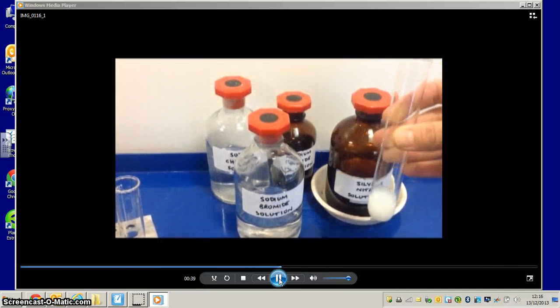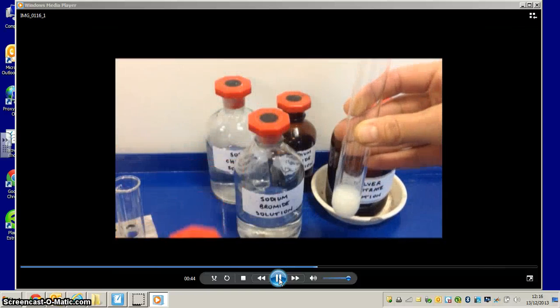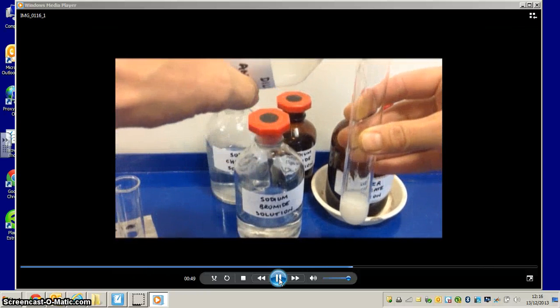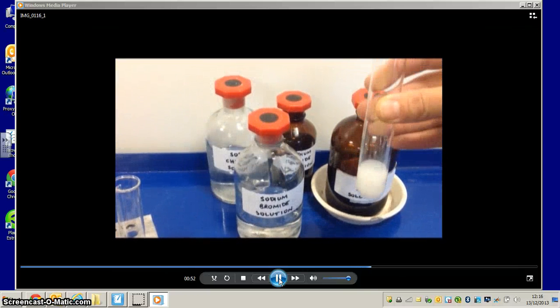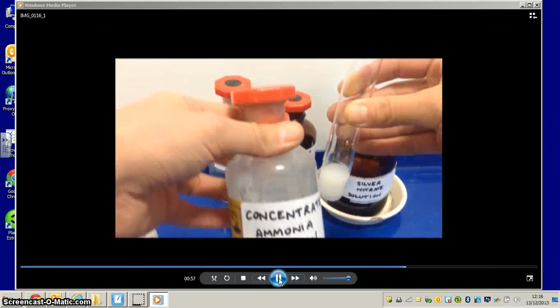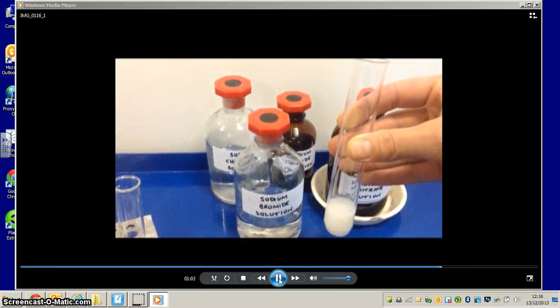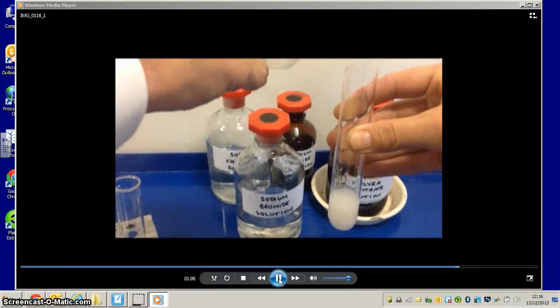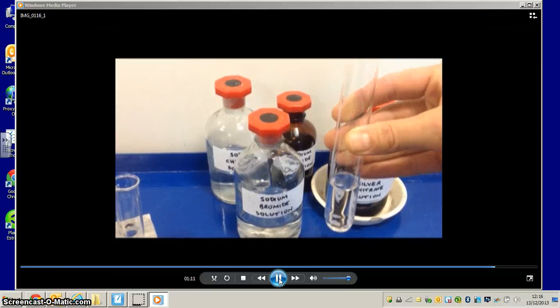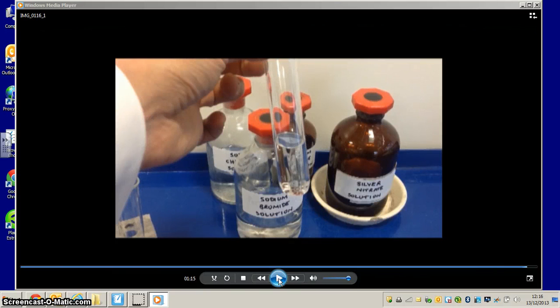Now here's the subtle difference. I'm going to add dilute ammonia to this precipitate solution. Give it a shake and you can see that with dilute ammonia solution nothing actually happens. So let's add a little bit of concentrated ammonia solution. And you can see that when we add the concentrated ammonia solution, the precipitate actually dissolves.